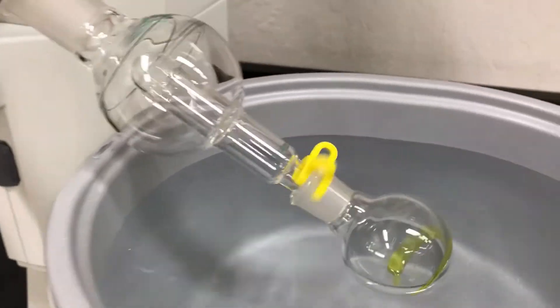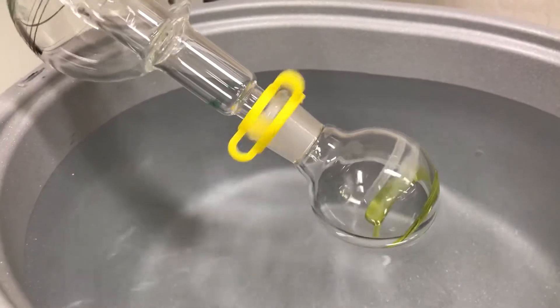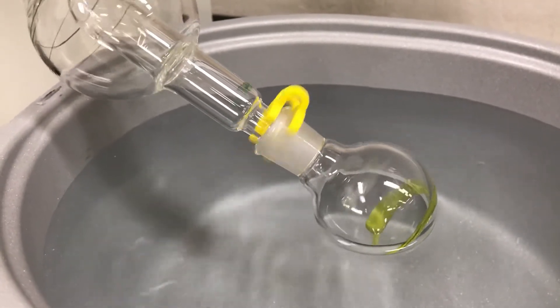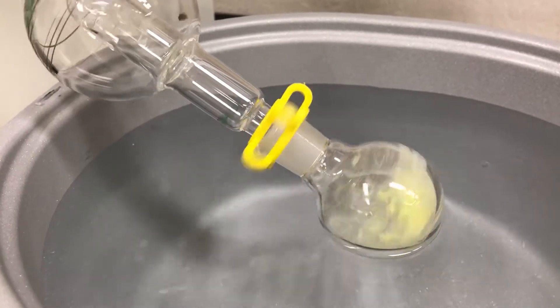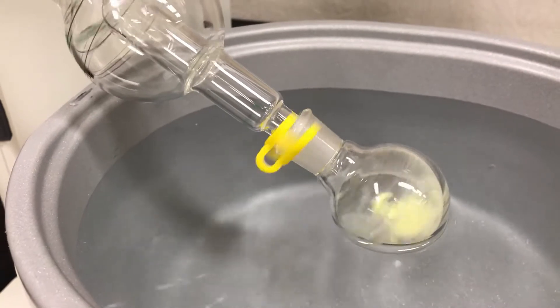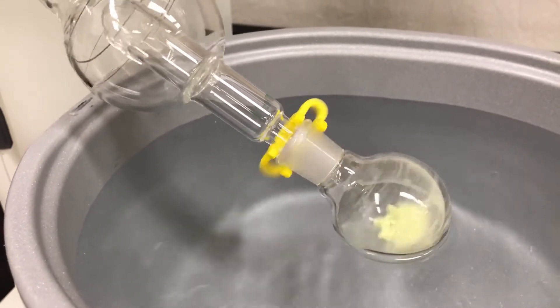So let's go back to normal time. For this example I am actually expecting a solid to form so I would just keep on evaporating until I see that solid. Whoa! That was surprising! So once I get the solid then just let it go for another minute or two to fully dry out.